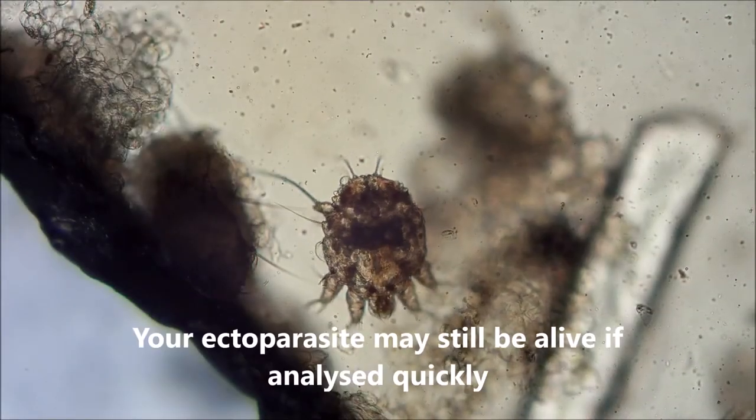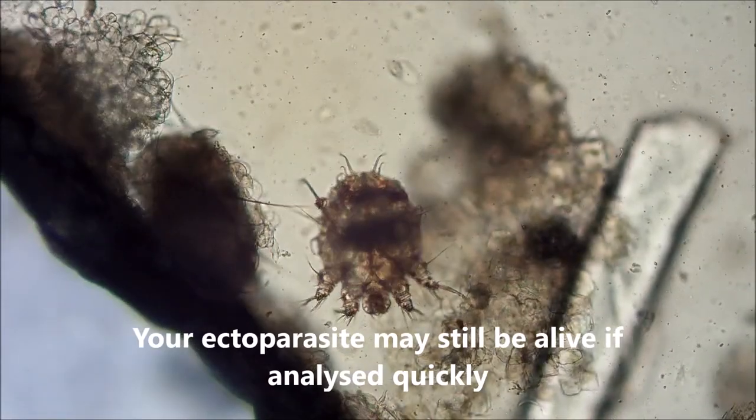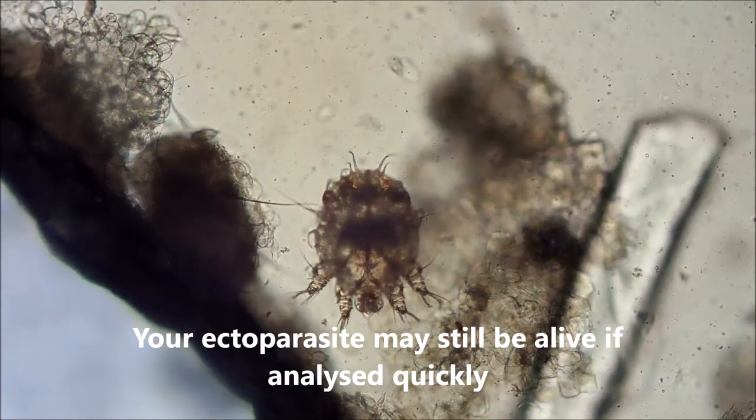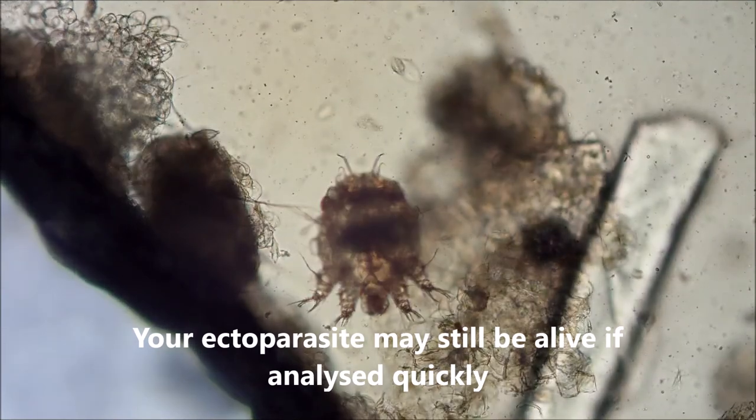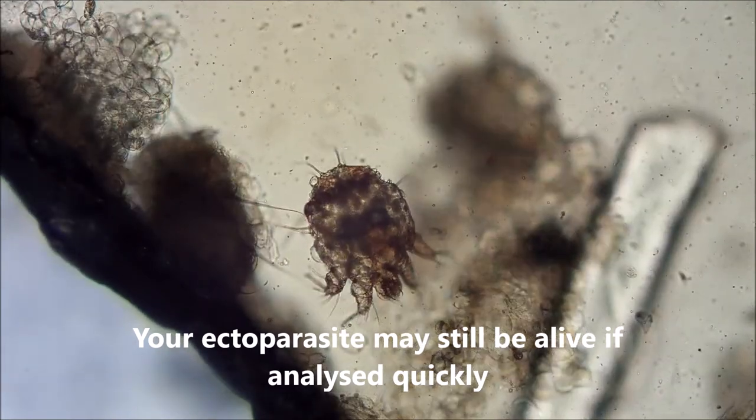If your skin sample is very fresh, your ectoparasite may still be alive. Please note this for zoonotic importance.